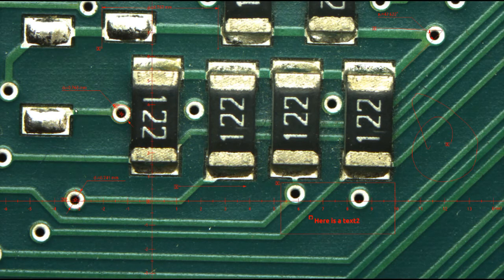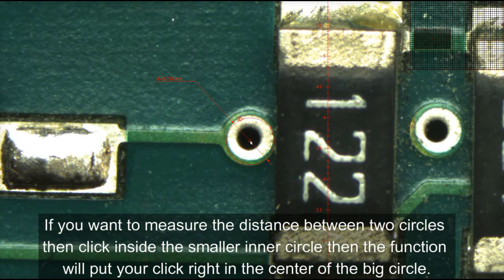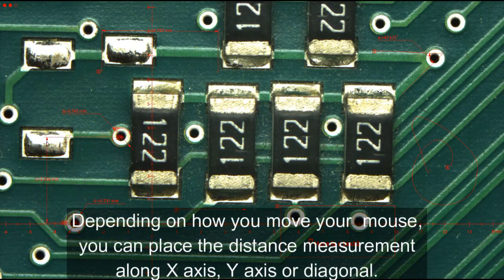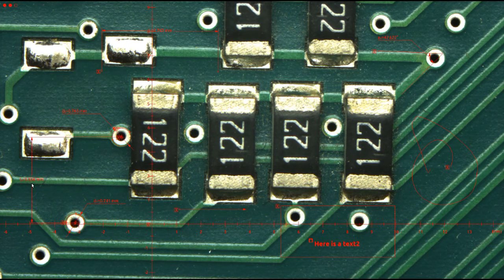If you want to measure the distance between two circles, click inside the smaller inner circle, then the function will put your selected point right in the center of the bigger circle. This way you cannot misclick the center of the circle. You can measure the distance between the two center points, but you can also measure the distance of the center points on the y-axis or on the x-axis.